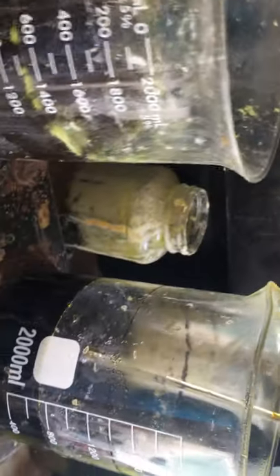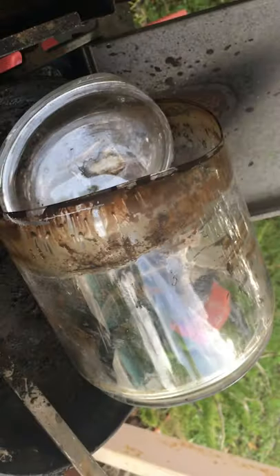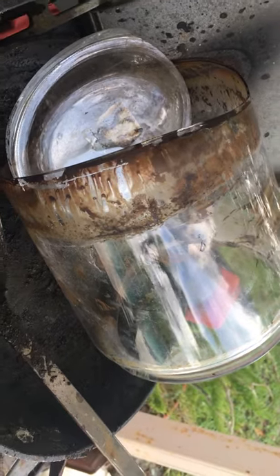Behind are those. Remember the filters I'm making? These are the filters in acid. These are leftovers from the silverware. Nitric. That is like the others, but possibly PGM precipitations.